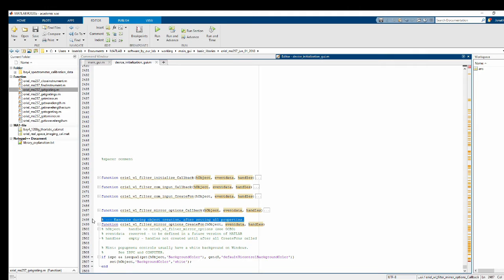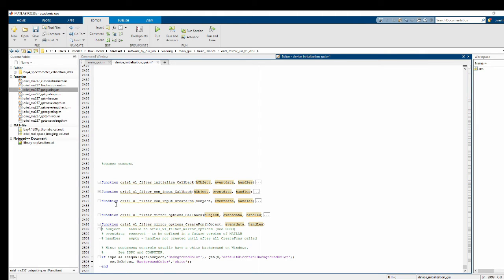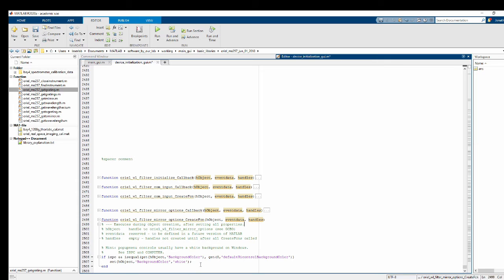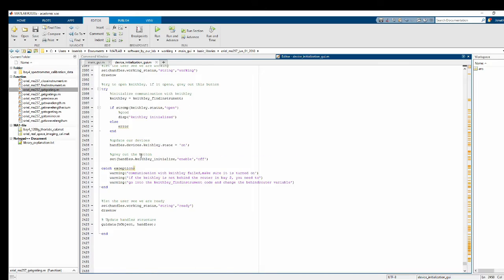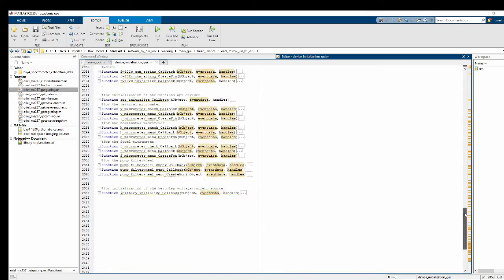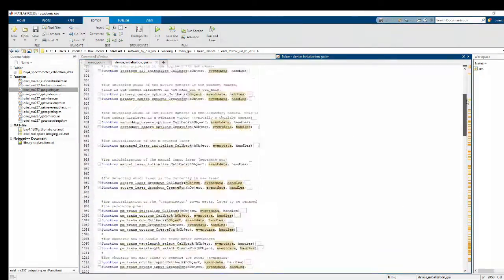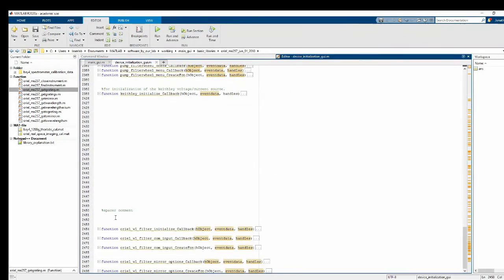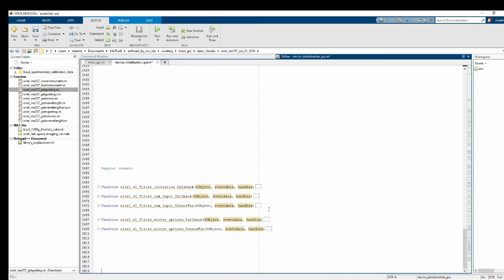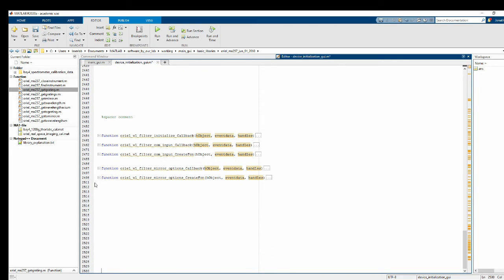And then when we're all done writing all this, I will move these to a more appropriate location in the code. Because right now what it did is it just threw it down here underneath my spacer comment. But if you look at how I actually organize this code, I group things up and add some comments and things to help out. But for now, we'll just leave them down here. Okay. Now, all right, we got through that. Looks good.